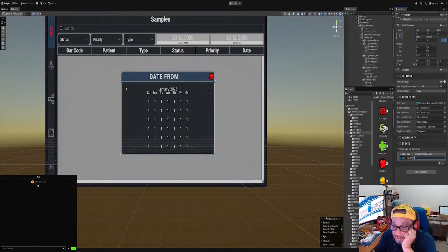All right, so that's string text, rich text, rich text. Font. I guess we don't have one. If I scroll down, maybe send message, set text. No, not set text. Update vertex data. Stop coroutine, set text. Maybe I'm missing something here. Let me go in here and look at the script.